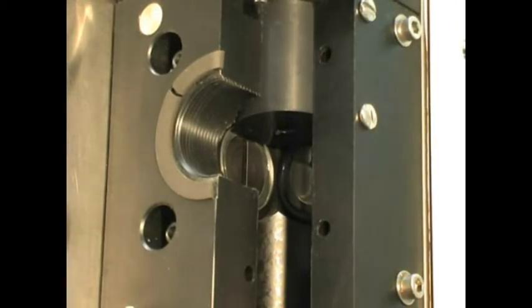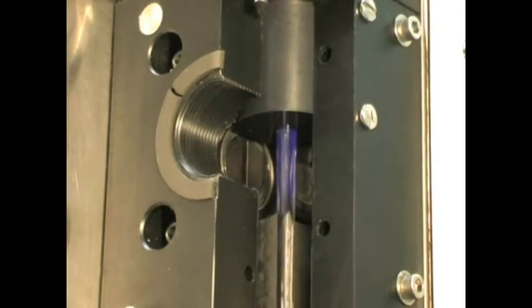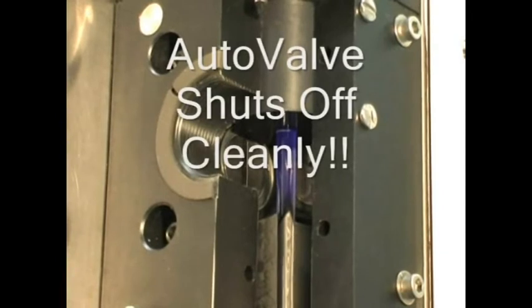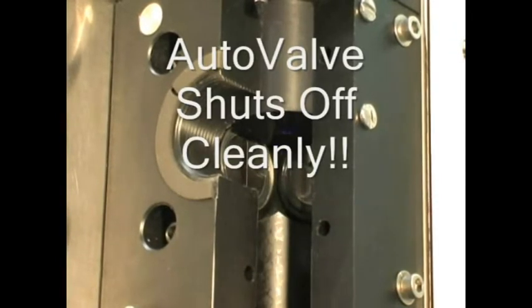Next, we show the effect of a flow start with no bubble trap or auto valve. In this case, the auto valve will remain in the open position while we pour water down through the bubble trap. Note the sloppy start of the water flow in the flow cell. This is what happens with no bubble trap or auto valve. And a clean stop using the auto valve.